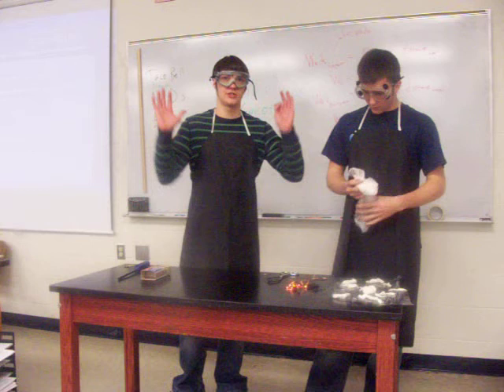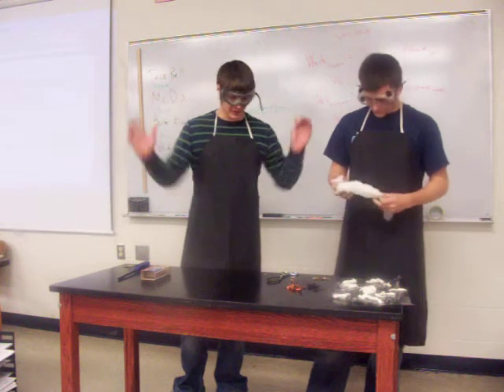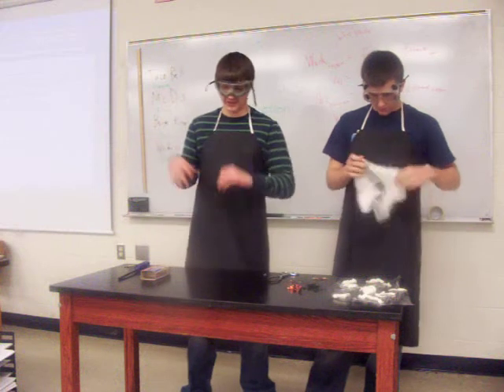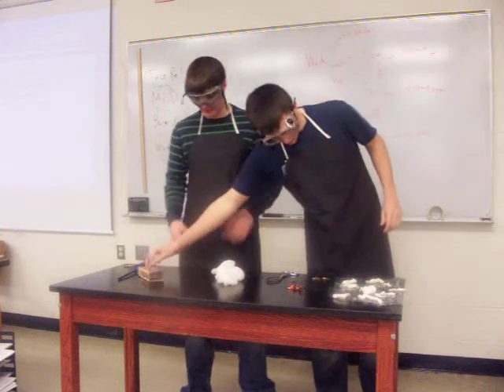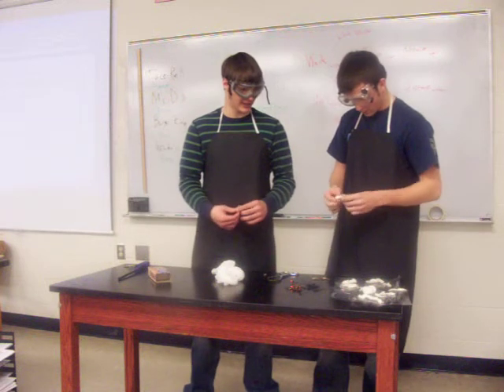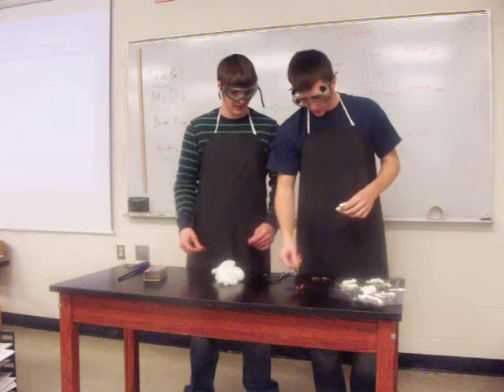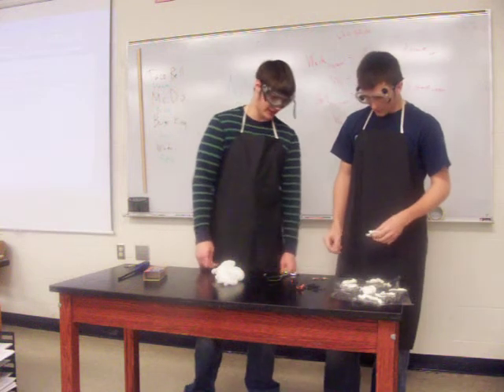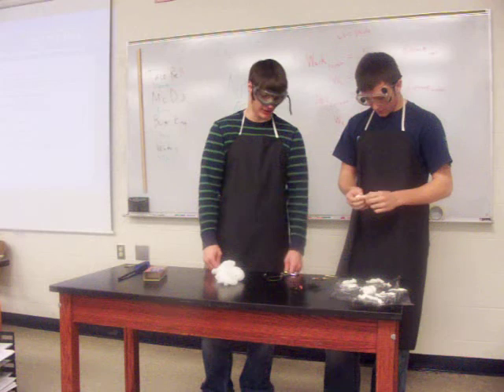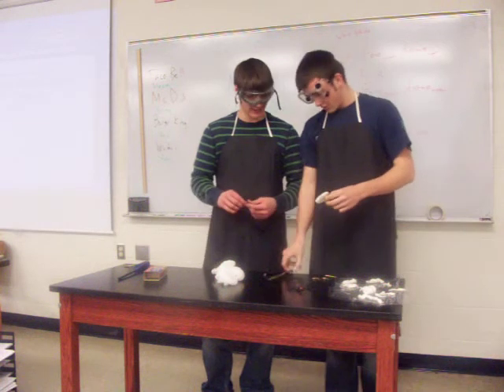which is why it's also called flash paper. Magicians use it a lot in their presentations, because you get a big fire and nothing left, so it looks like magic. But if it doesn't do it right, then you're left with stuff. And it's burning all the way. It's slowly becoming nothing, but the stuff that hasn't been completely soaked or isn't dry is not. That's where we're coming with that.